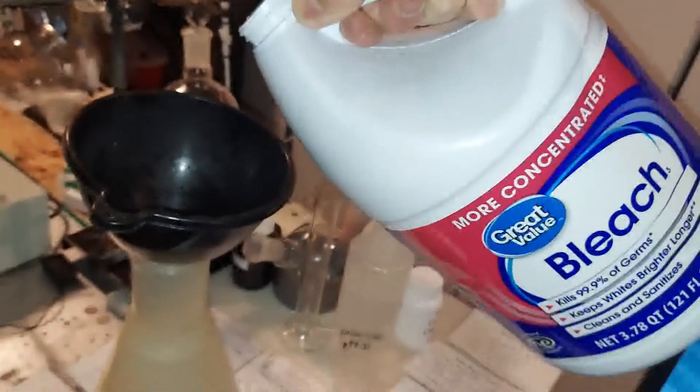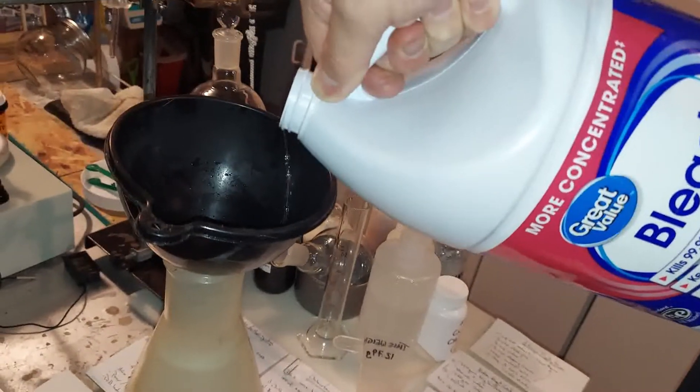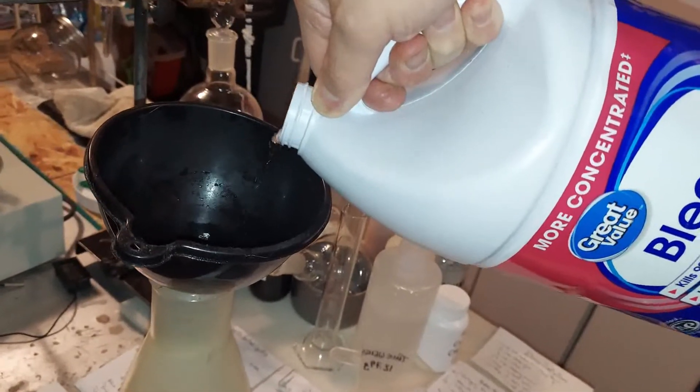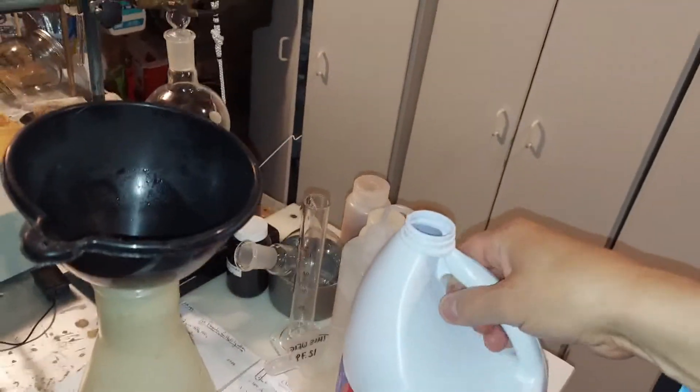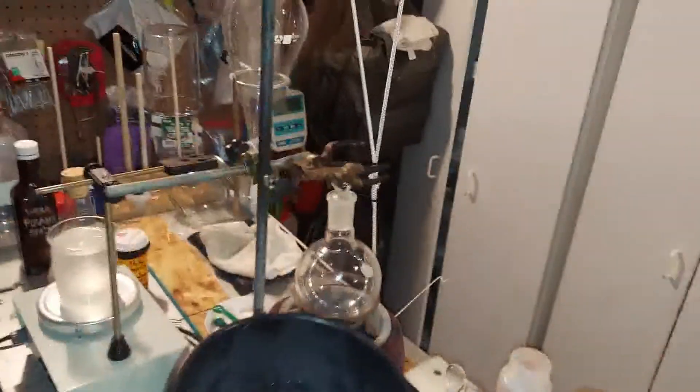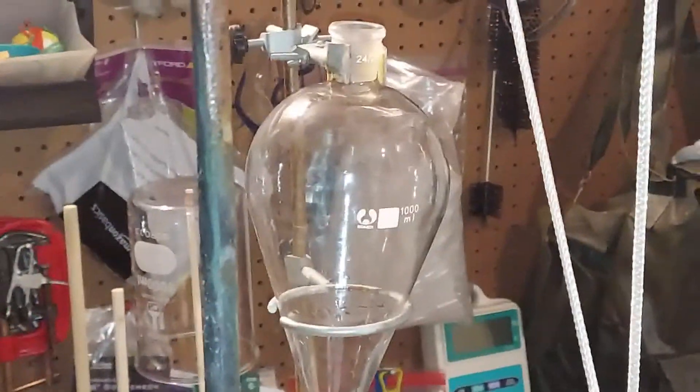Hard to tell exactly how much is left here, but that's gotten pretty full, so we'll call it quits right there. All right, put the rest in the separatory funnel, which is sitting right over there.